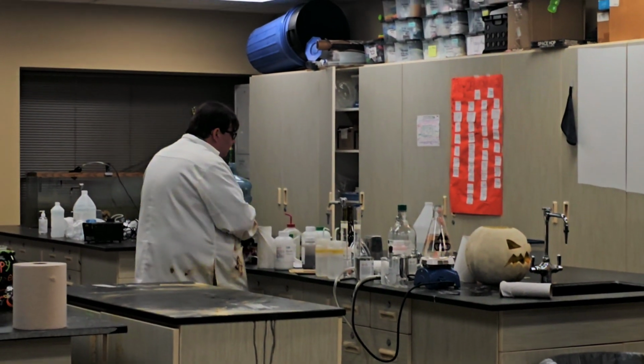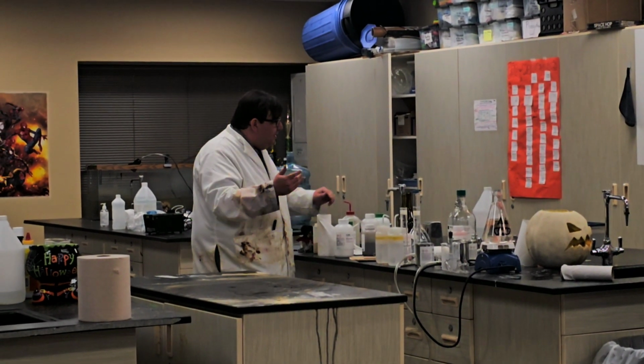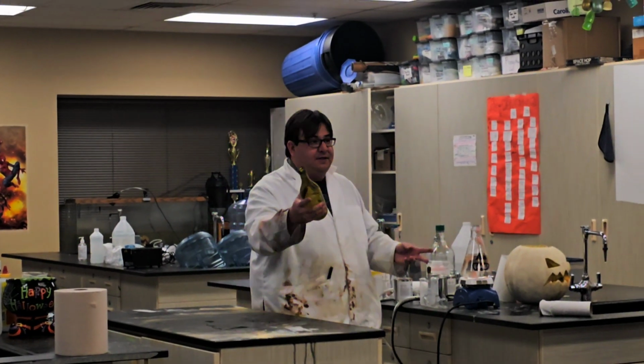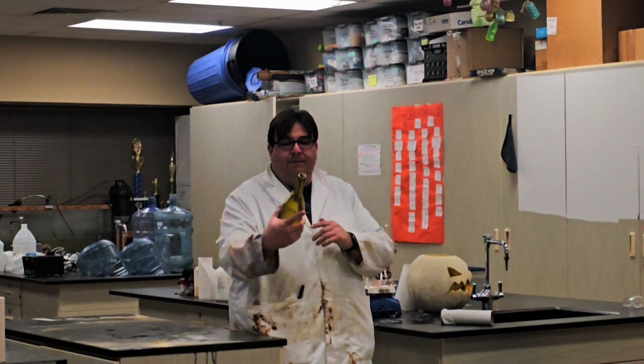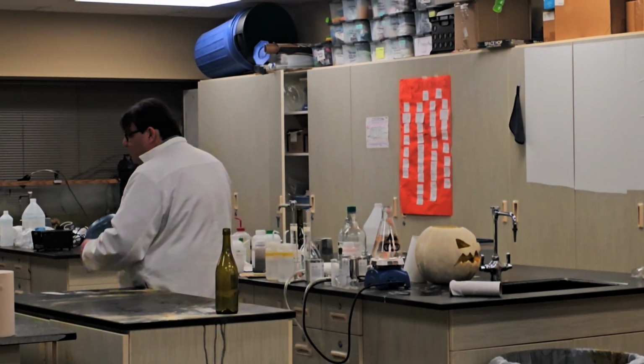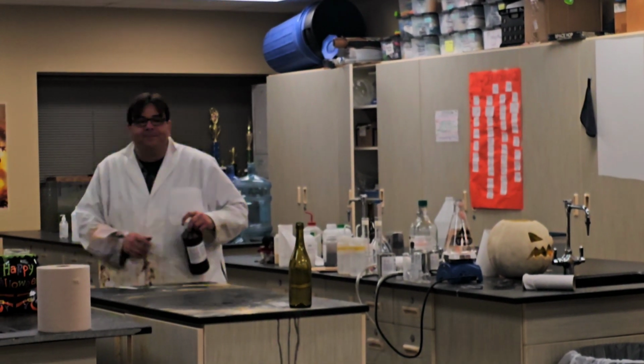So, this next one, once it starts going, I'm going to need you guys to come up and smell this, okay? I have a magic bottle here. We're going to make a genie come out, but I want you guys to smell the genie, okay?